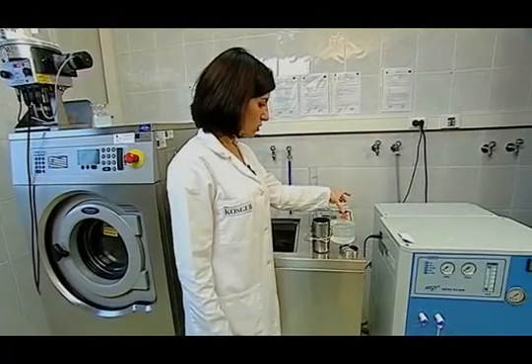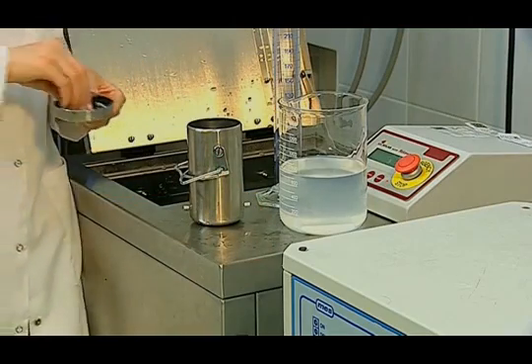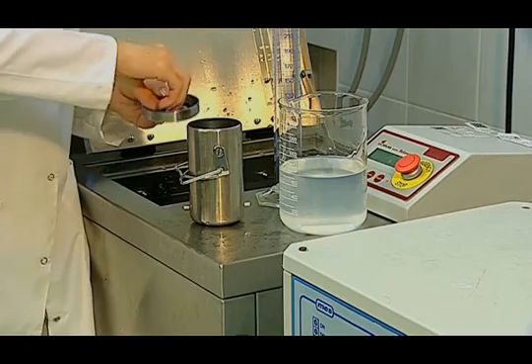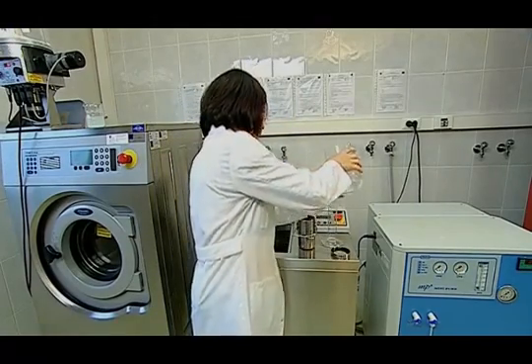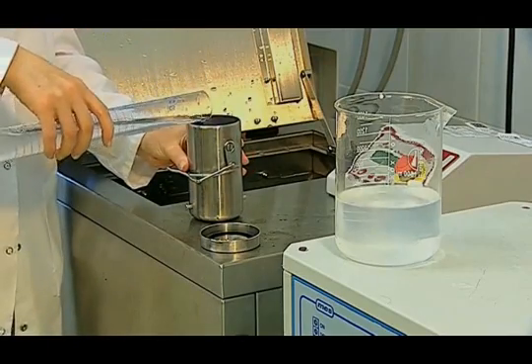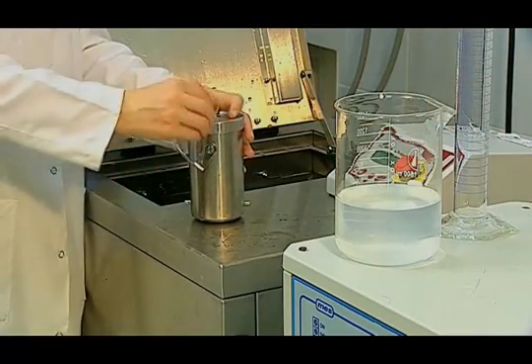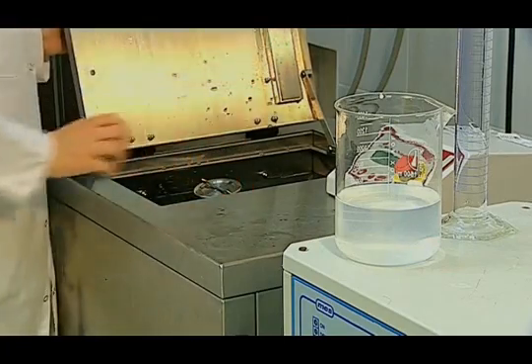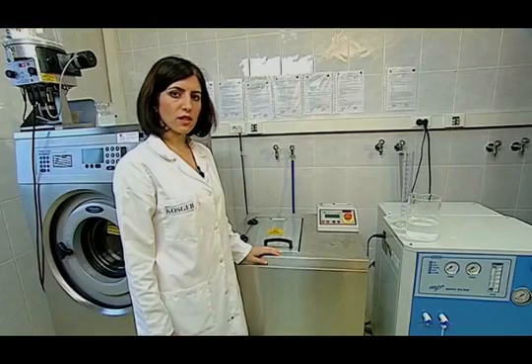The prepared washing solution is at 40 degrees centigrade. The test sample is put into steel containers. Ten pieces of steel balls are put into the container. The amount required for the test solution is measured at 150 millilitres with the graduated cylinder and poured into the container. The lid is closed and it is placed in a preheated device at 40 degrees centigrade. By pressing the start button, the test is started. The sample is subjected to the test for 30 minutes in the device.